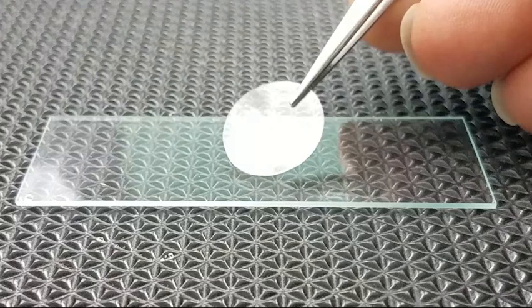Use a pair of forceps to remove a young leaf from the tip of a water plant Elodea. Place the leaf in the water on your slide and cover it with a cover slip. Use the scanning or low power to observe the leaf of Elodea. Finish by observing the leaf on high power.